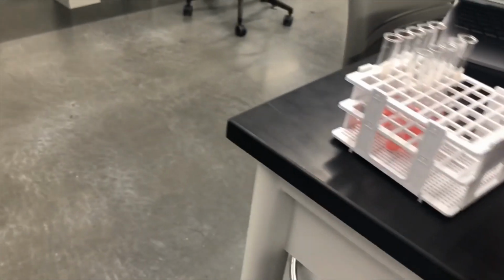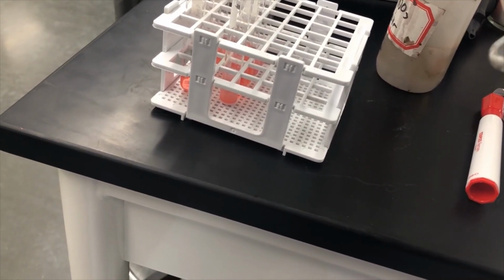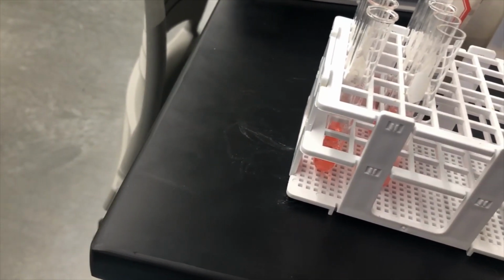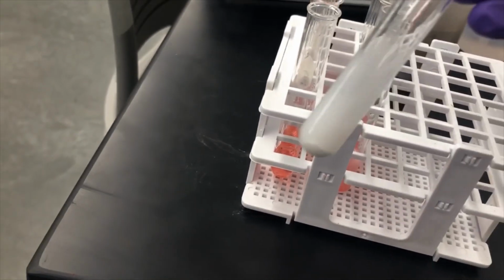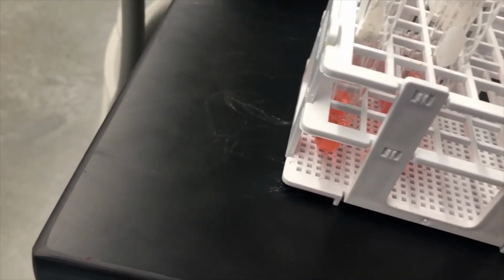So now we have this mixture. I've already put it all together. There's 2 compounds in here. So first things first, let's check the solubility. There's a lot of solid in there, so I'm actually going to add a bunch of water just to really make sure.